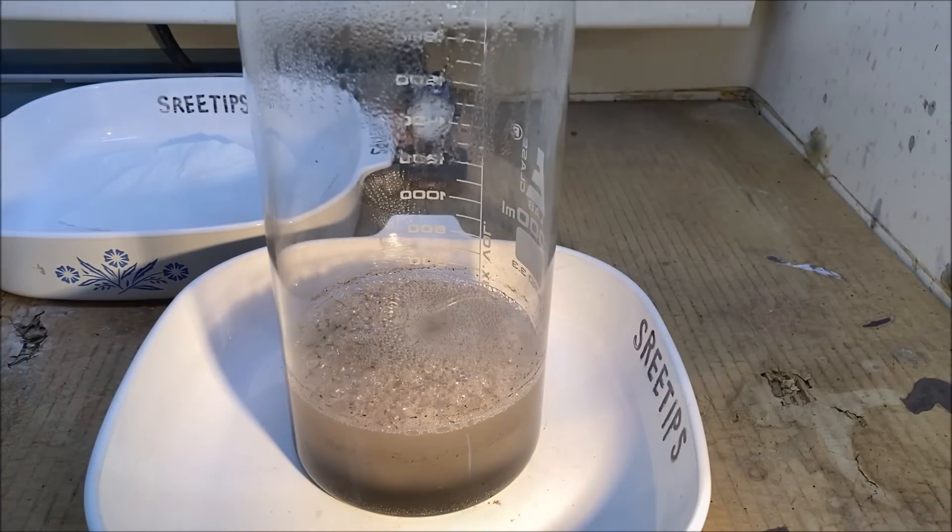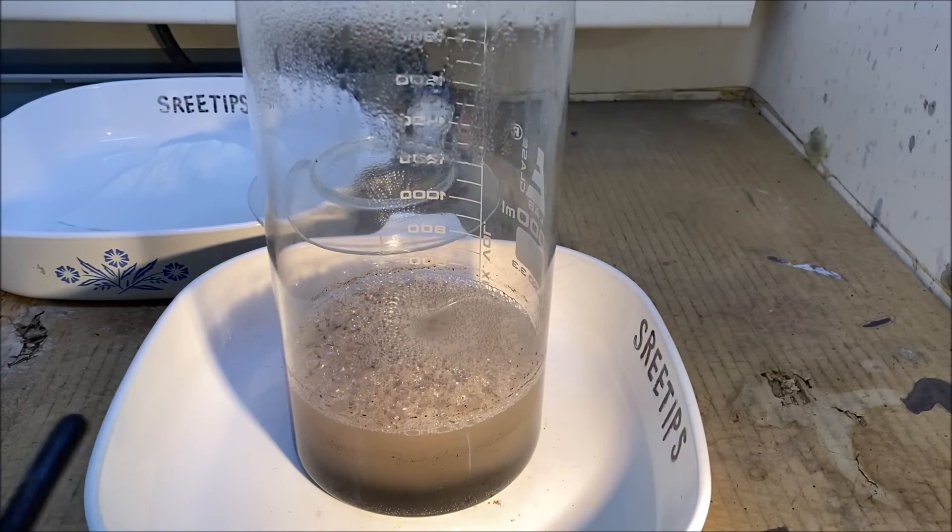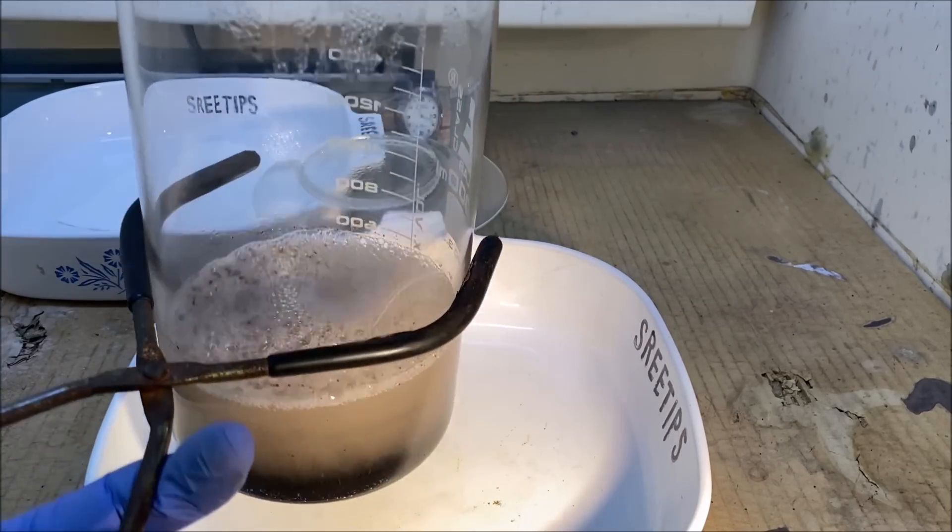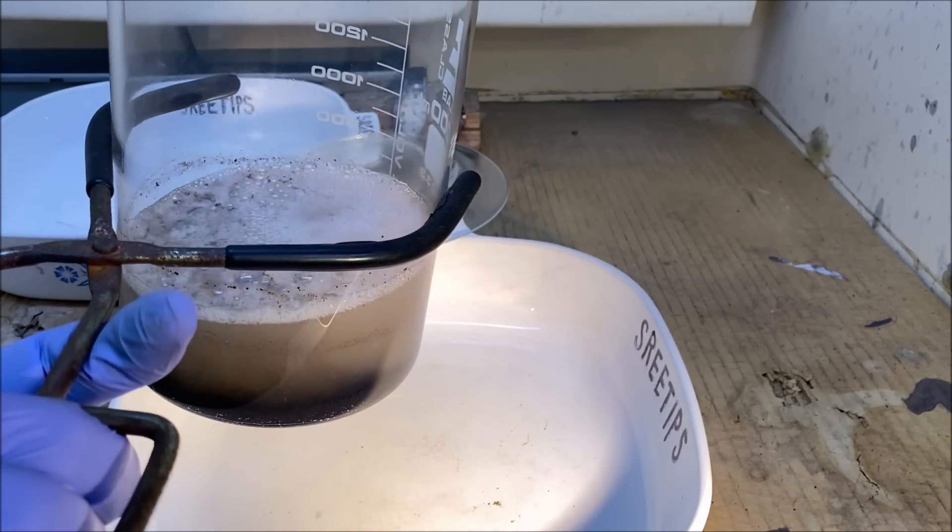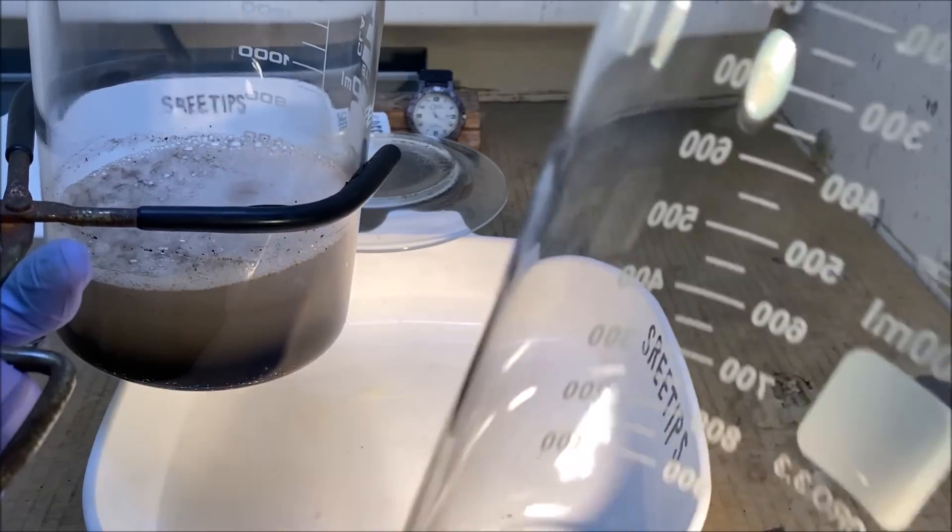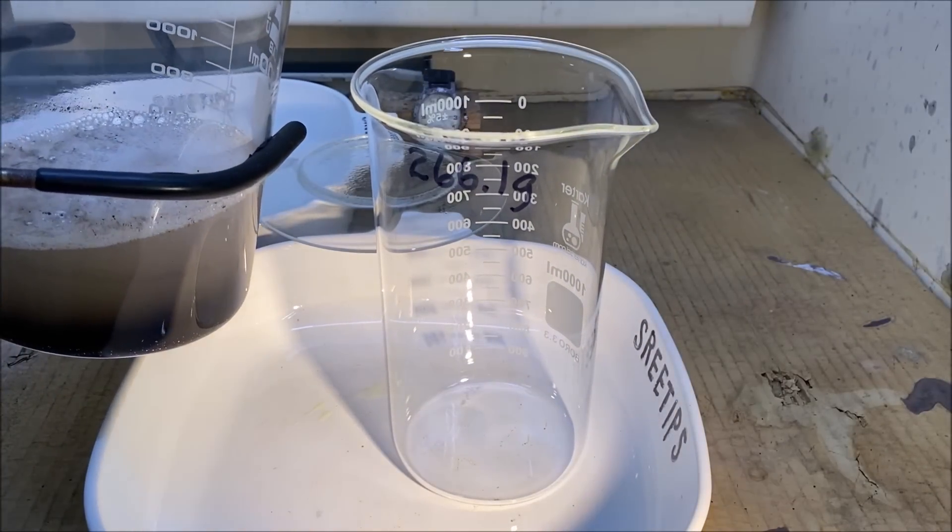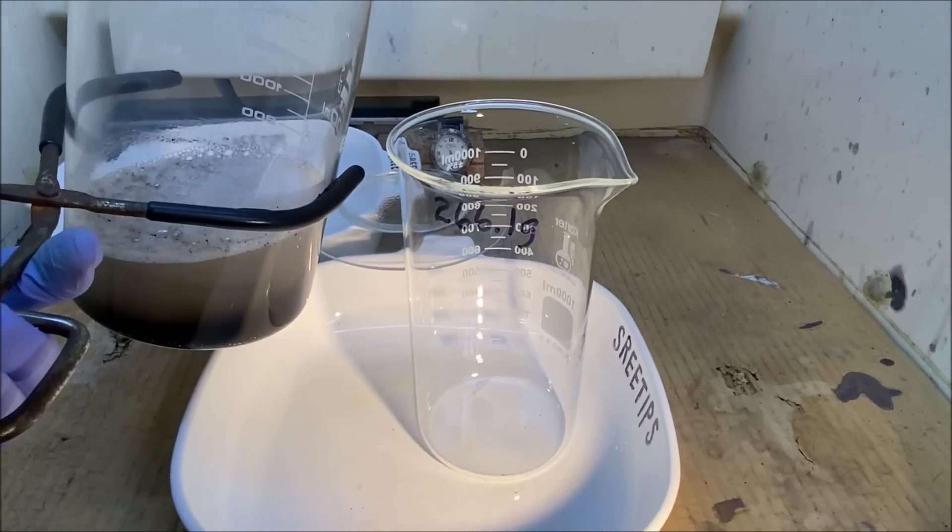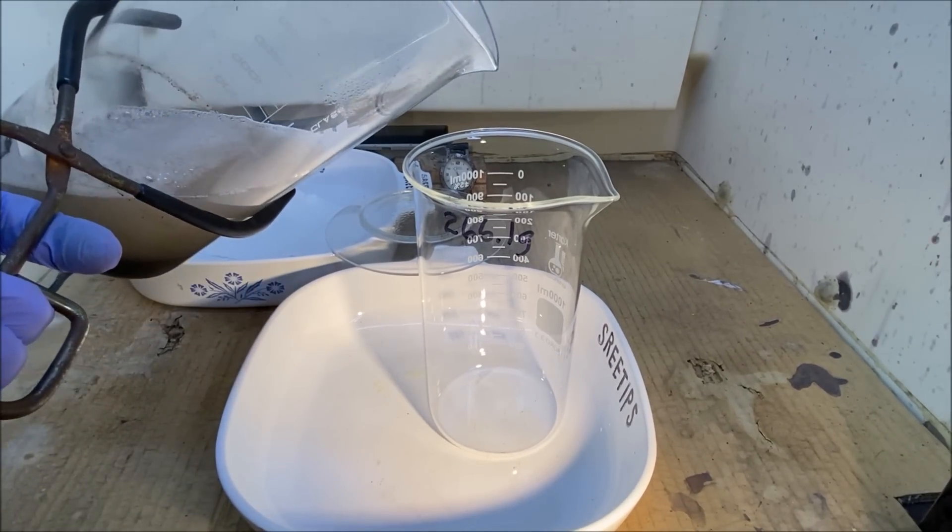I think I've got everything to come out of solution. So what we'll do now is we're going to transfer this material into a clean beaker and it'll be a little easier to work with.